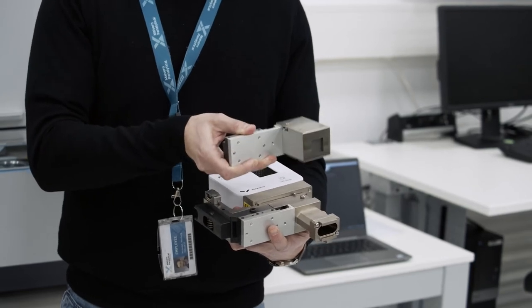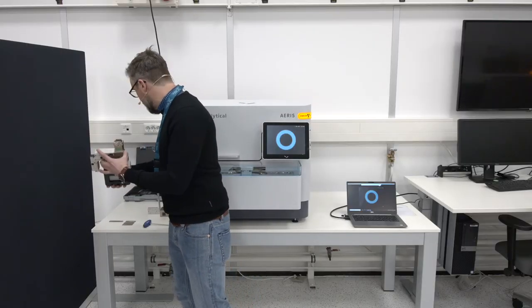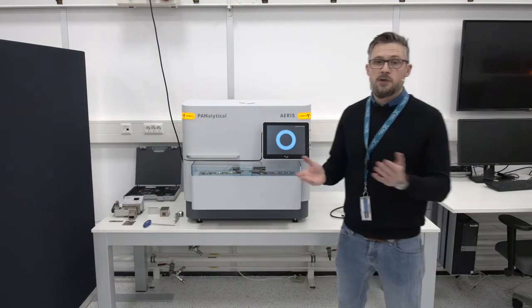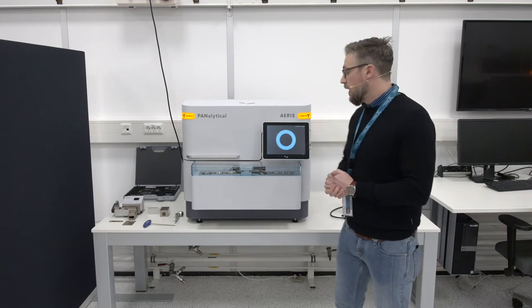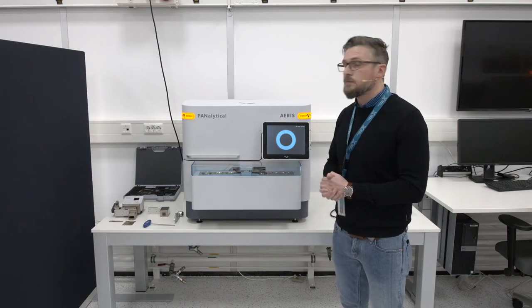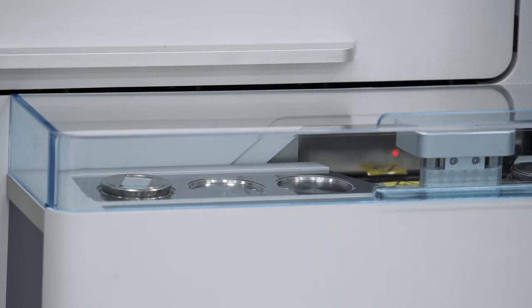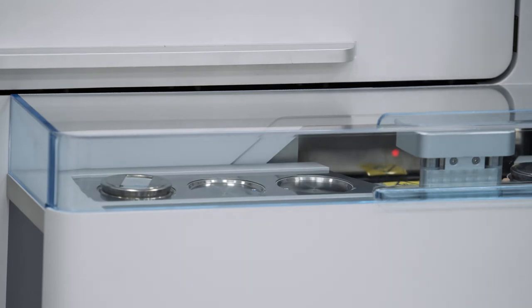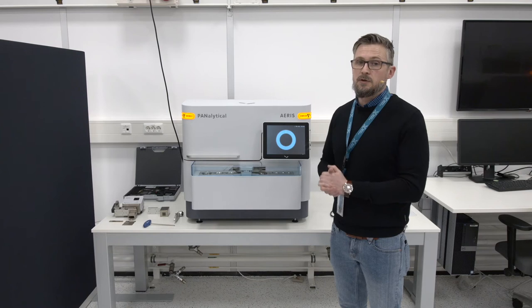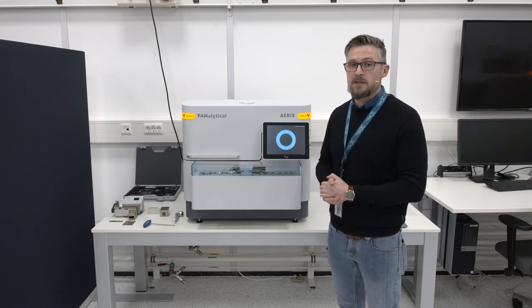This is what we are going to use for our first demonstration. To demonstrate the benefits of grazing incidence measurements on thin films, the easiest way is to show the two different measurement geometries. I have selected a thin film sample — an indium tin oxide deposited on glass. It is quite a thin layer, so in a normal Bragg-Brentano measurement you get a lot of interaction from the substrate. We will begin with a Bragg-Brentano gonio scan and afterwards switch to the parallel beam geometry for a grazing incidence measurement.